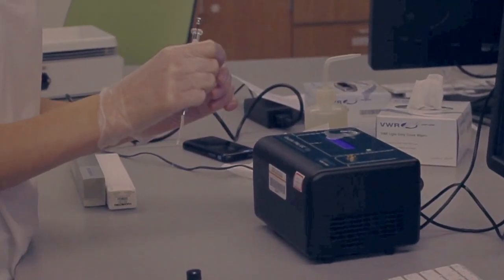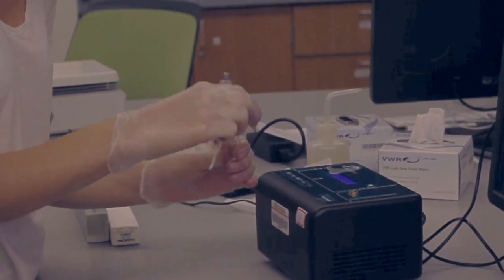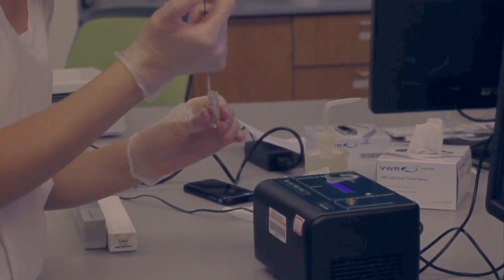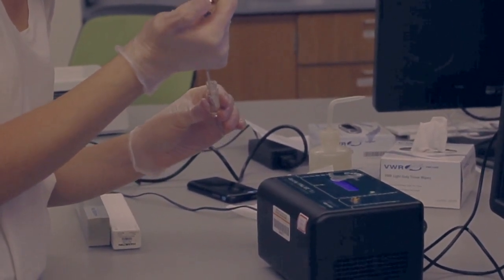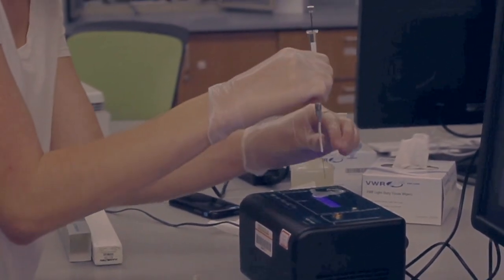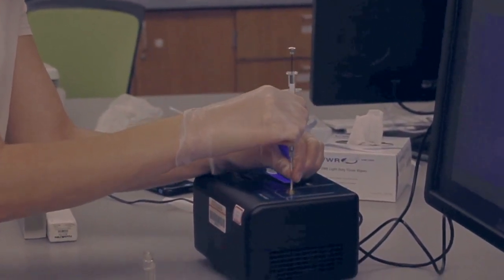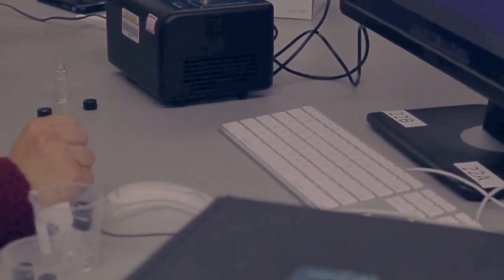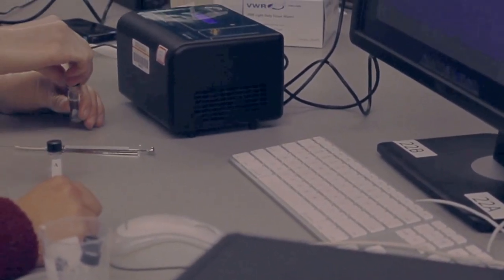Once the GC is at the start temperature and the syringe is clean, it is time to inject the sample. Caroline will draw the appropriate amount of sample into the syringe, making sure that there are no air bubbles. Next, Caroline will inject the sample and I will click Start simultaneously. It is important to inject the sample and click Start at the same time. After the compound is eluted, it is advantageous to reset the start temperature because it may take a while for the GC to return to the start temperature.